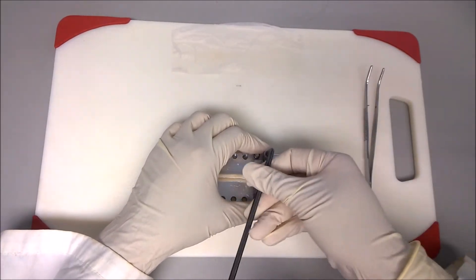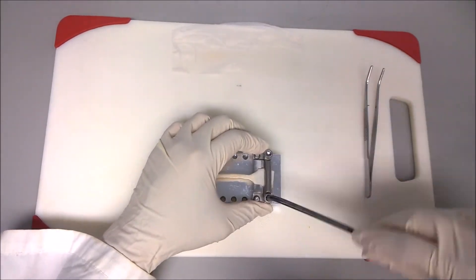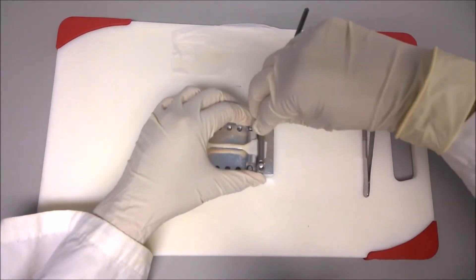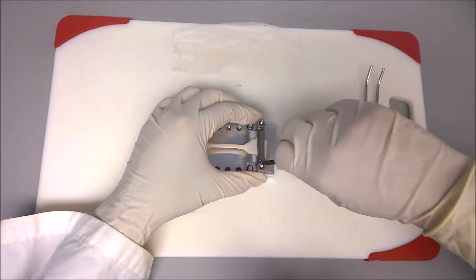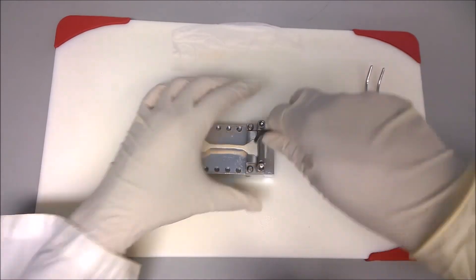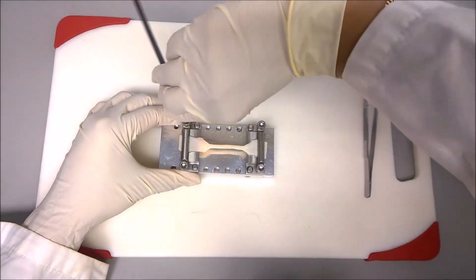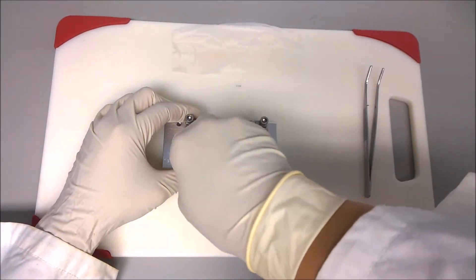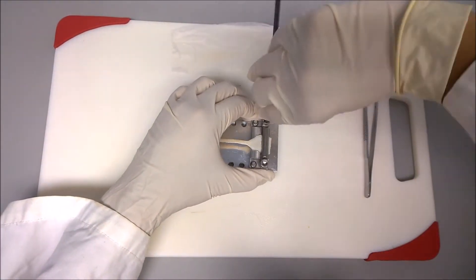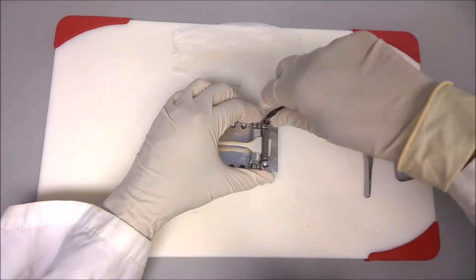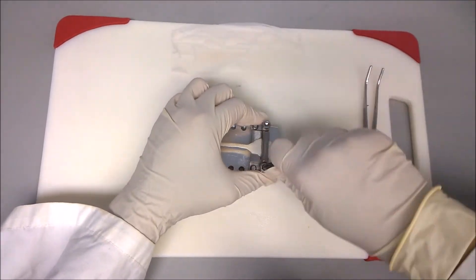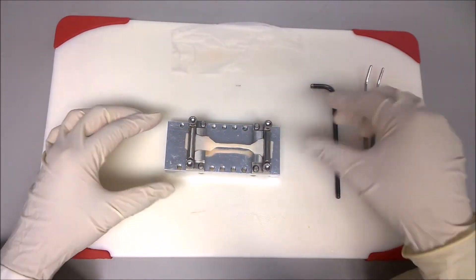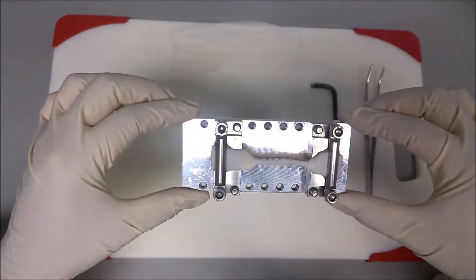Alternate tightening both screws to evenly compress the sample, and do not overly compress and crush the sample. Hydrate the sample with PBS solution to ensure it does not dry during the procedures.